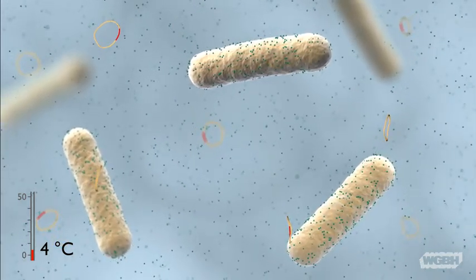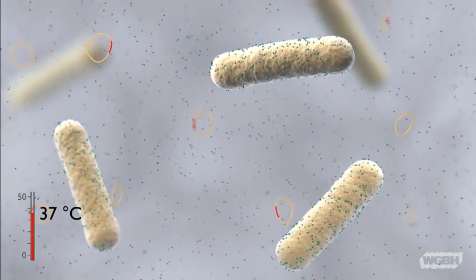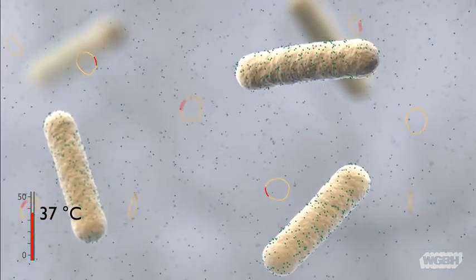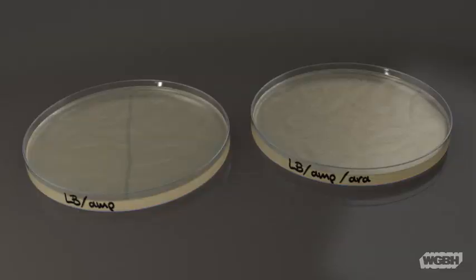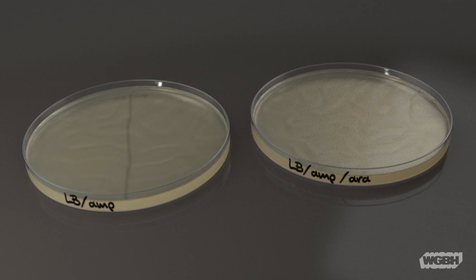After heat shock, the bacterial cells are placed at 37 degrees Celsius and allowed to recover before being plated. Bacterial samples are now put on agar plates to test for successful transformations.